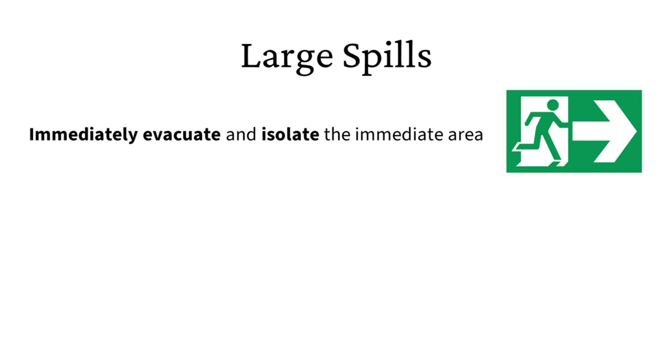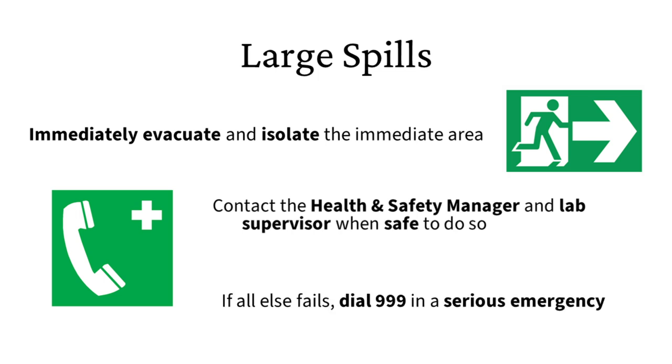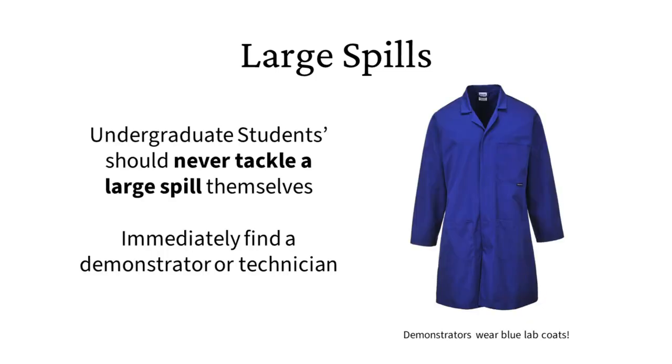If a major spill occurs or a spill occurs outside of a laboratory which presents a greater risk, everyone in the immediate area should be evacuated and access prevented to stop anyone entering. Contact the health and safety manager as soon as it is safe to do so, and, if possible, whoever is responsible for the lab, so that additional support from the school's emergency team and first aiders can be provided quickly if needed. Undergraduate students should immediately contact the demonstrator and should never try to tackle a large spill themselves.